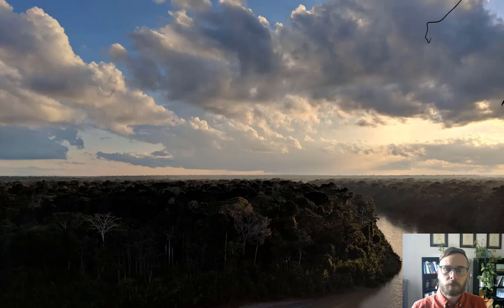Hi, this is Stockton Maxwell from the Department of Geospatial Science, and today I'm going to run through a quick tutorial on how to use Coorecorder to measure samples for tree ring analysis. So let's start out, open up the software, and we'll do a walkthrough.